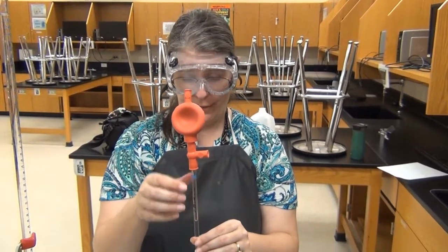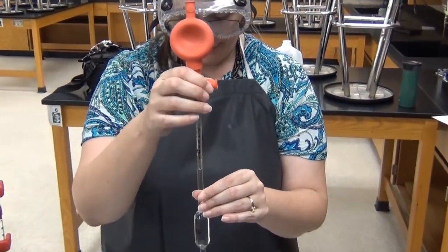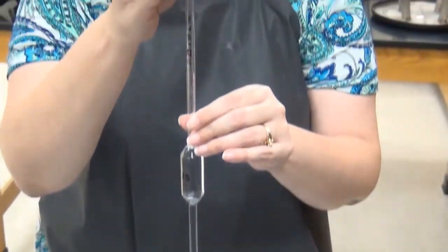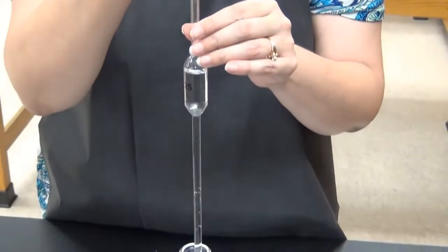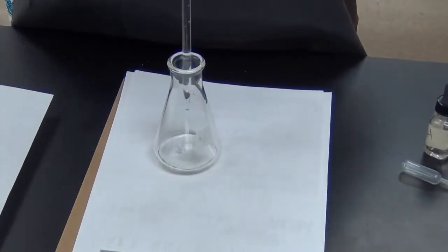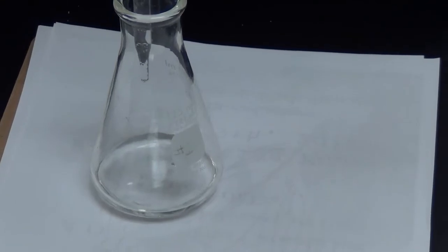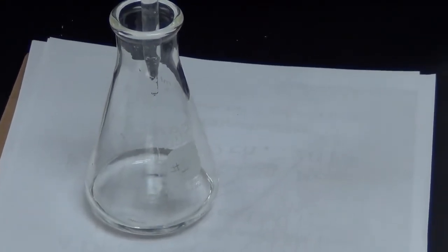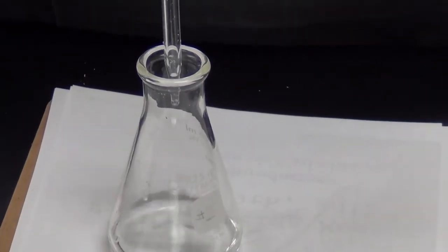I use the plastic bulb to generate suction to suck up 25 milliliters here, and now over on the side where it's marked E for empty, I squeeze this and this will put the solution into the flask. I'm using 25.00 milliliters of my starting acid solution. So it's an important number that we know very exactly. Our acid is 25.00 milliliters because I'm using this very accurate measuring equipment.